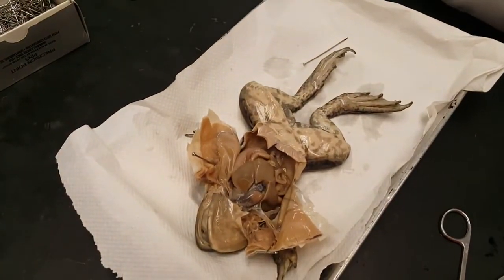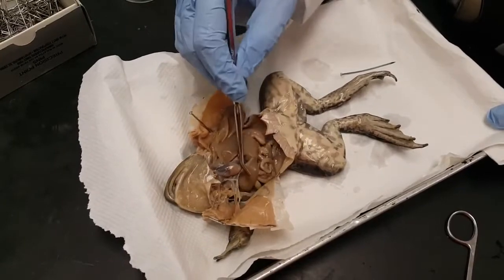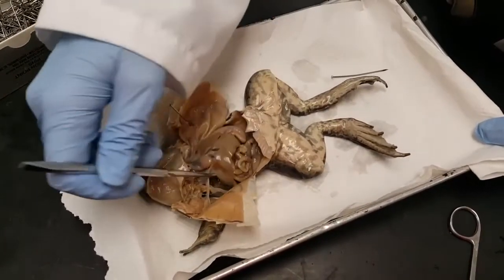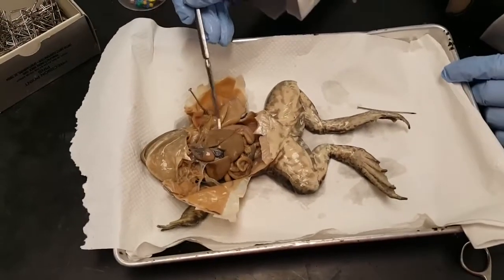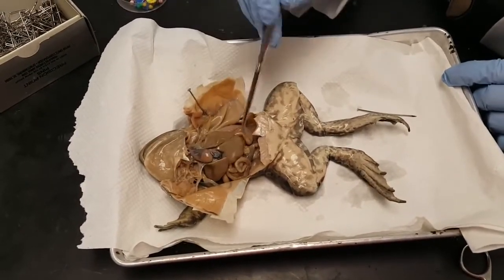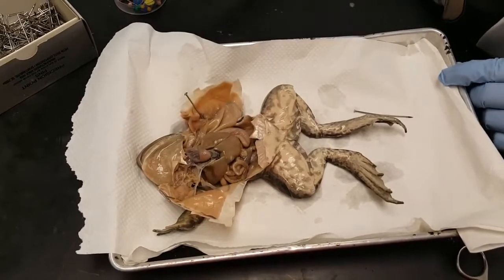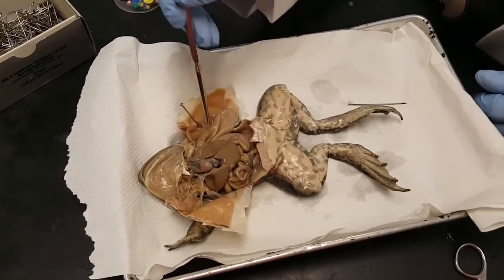The first feature you see in the frog is the largest organ here, which is the liver. The liver is actually divided into three sections: we have the right lobe of the liver — and it's always the frog's right — and then we have the left anterior and the left posterior. One way to remember that is to think there's only one right way to do something; the frog only has one right lobe, but it has two lefts.